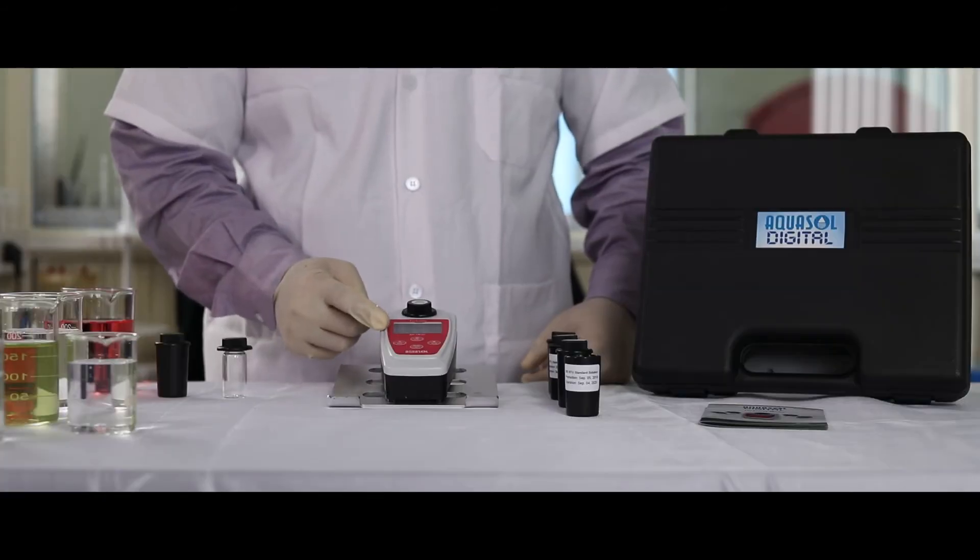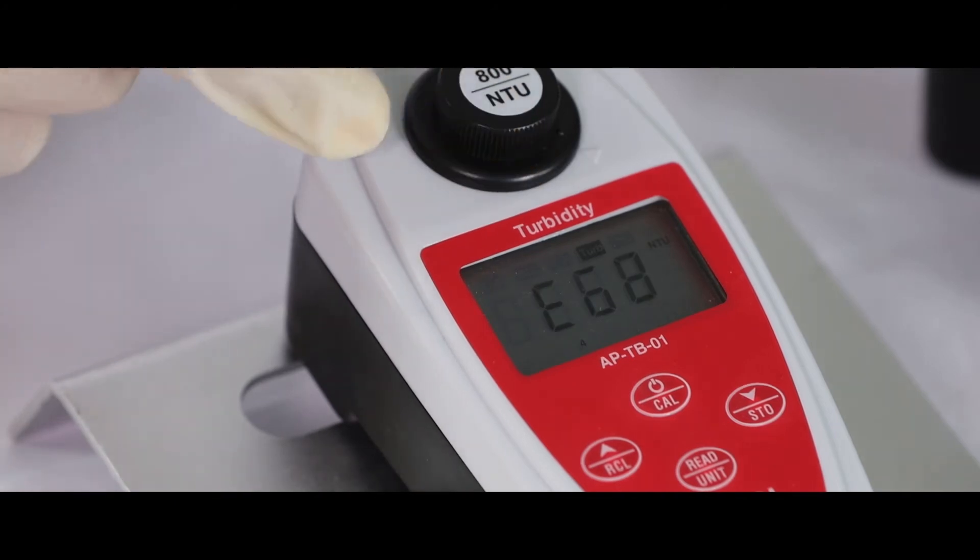Once the calibration is done, the display will show SA and end.